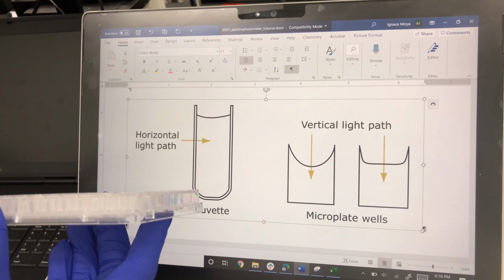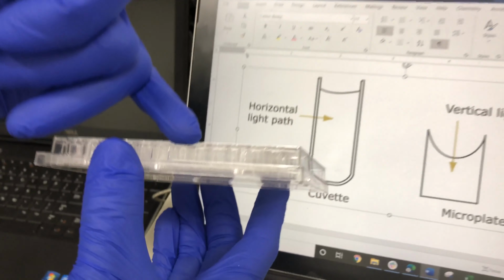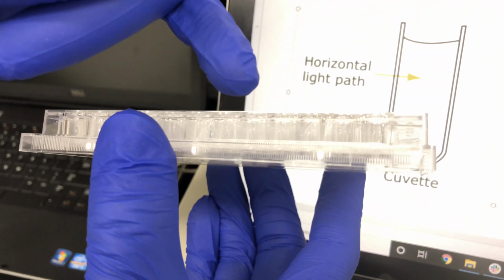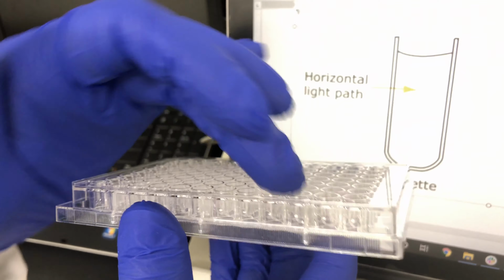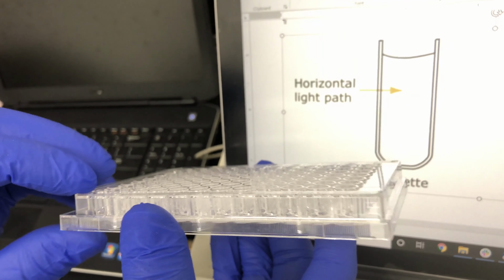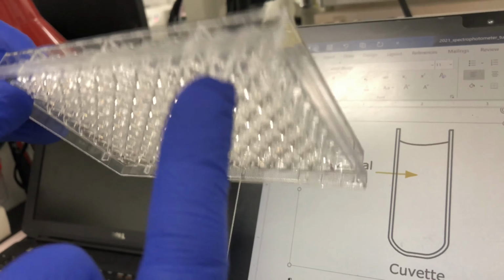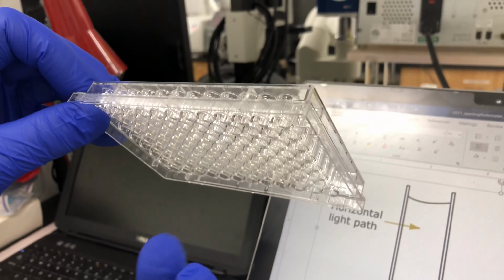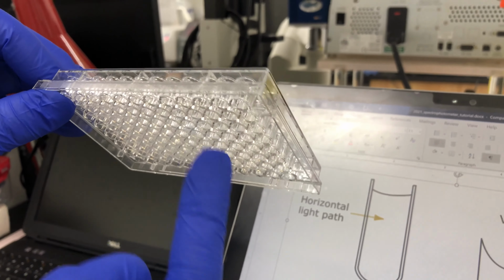So what I recommend is you try to fill up these wells to the highest volume. Typically these would be around 280 microliters to about 300 microliters. You'll have to see when you pipette, and just make sure that there's no bulge on the top. And the last thing is that when you want to take the reading, you want to take the light from the bottom, a bottom read, and this will minimize the light scattering if you do it from the bottom.